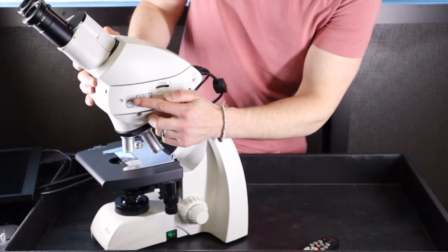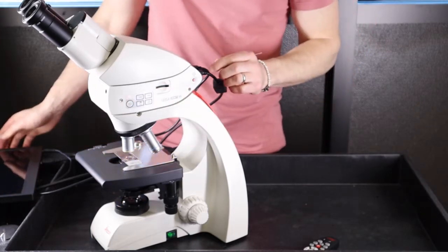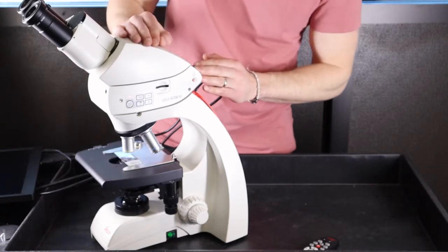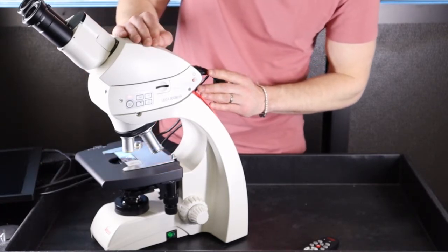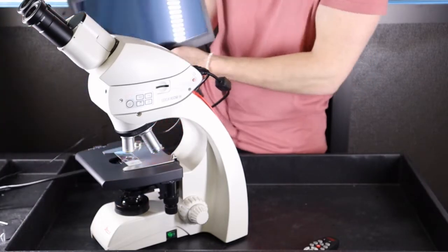As the camera boots up, the red light will blink. Since the camera is plugged into the HDMI port, it will recognize that as the output method and boot up in HDMI mode.